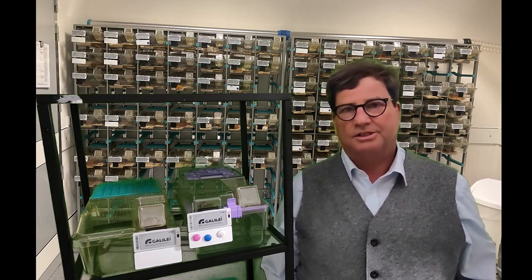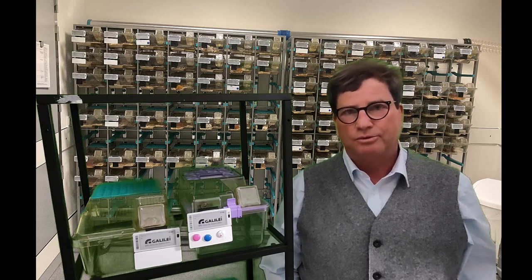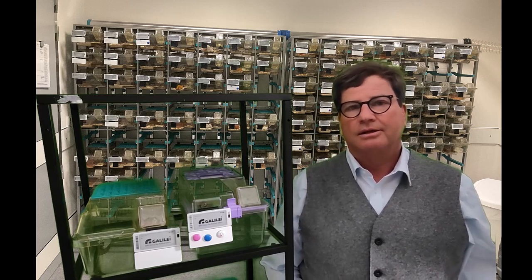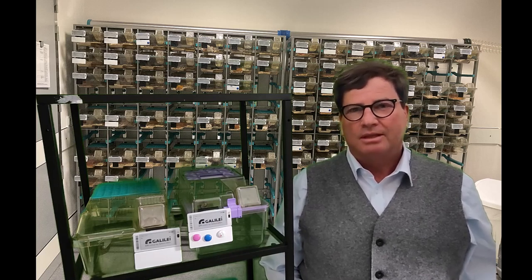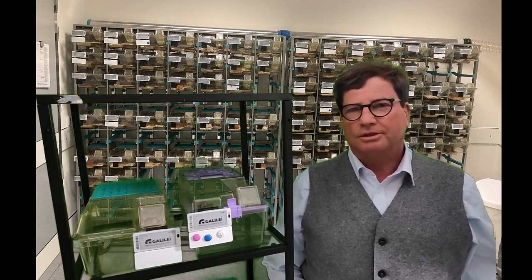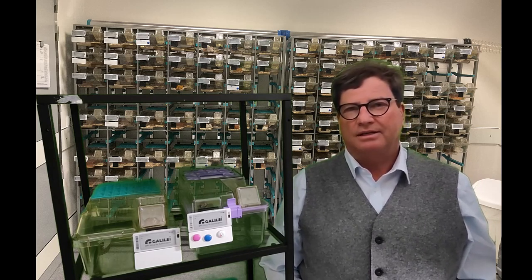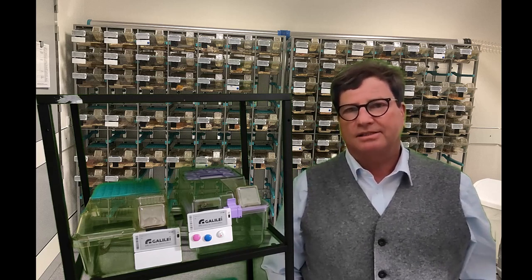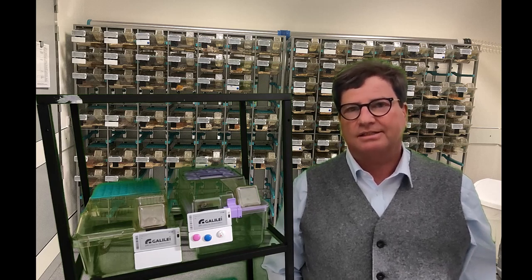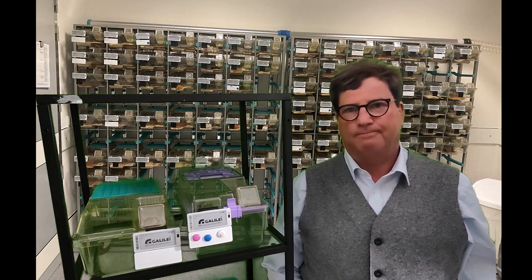Today I would like to discuss how you can improve communication in animal rooms and how you can forward this information outside. I want to give you some alternative suggestions how you can signal events on cages and pass this information to the researchers and scientists based on the data of your animal management system.